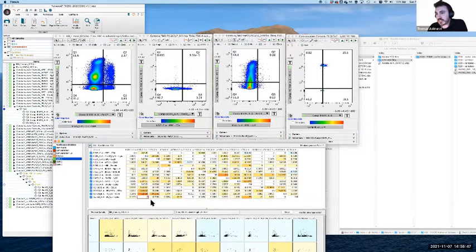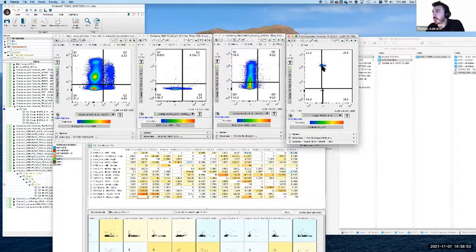So I'm going to, let's say, make this value 1, just for example. Oh, that's actually pretty close. The machine will, oh, I didn't realize you can move those separately. It's terrifying. Okay, so the machine, when it calculates compensation, will do this much more accurately than I am by eyeballing it. It'll actually calculate the median of the positive and the negative and line them up. But for our purposes here, the visual way of doing this just looks and feels a little bit more intuitive.